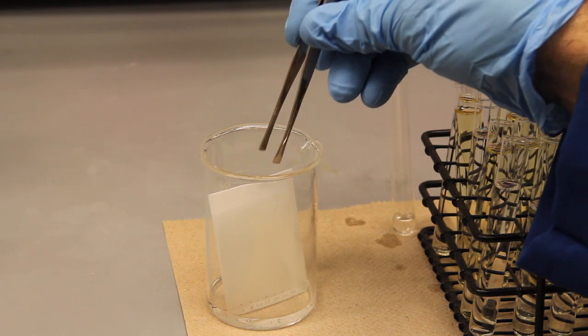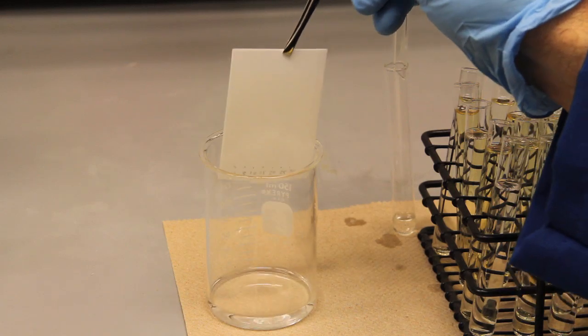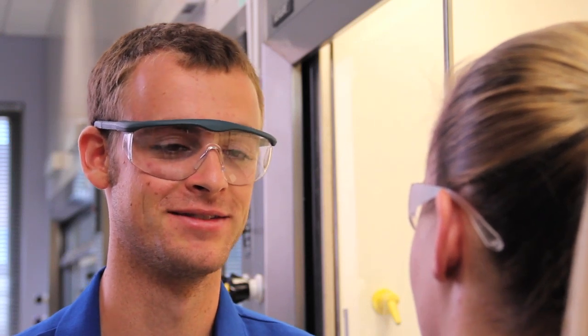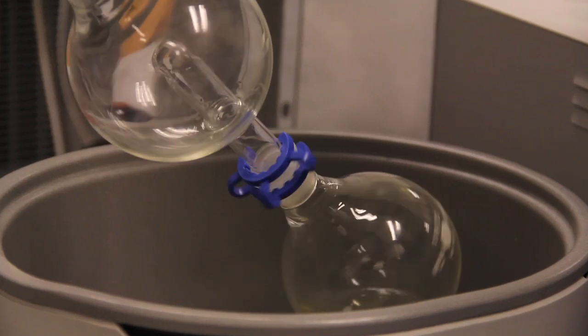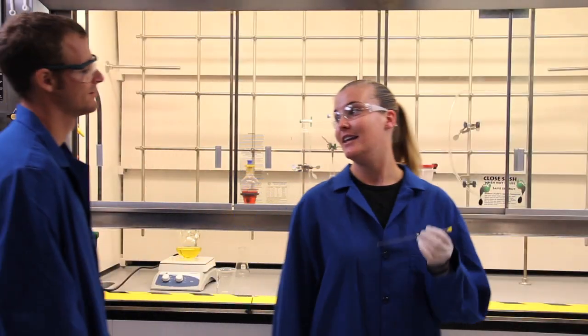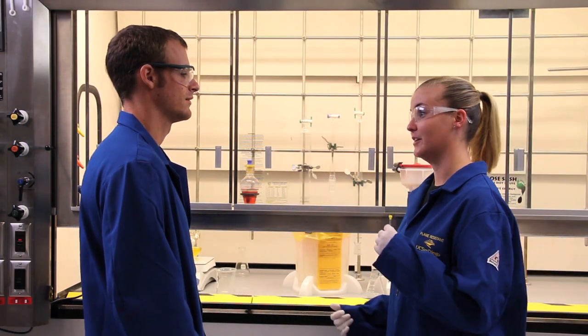It's better to use several stains before you decide which fractions to combine. I'll collect the fractions and evaporate. Never discard any fraction until you've confirmed its identity by NMR. Sure, I guess it's better safe than sorry. Now that we know we have our compound, we can dry the column.